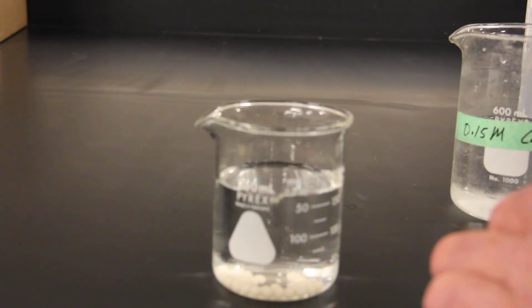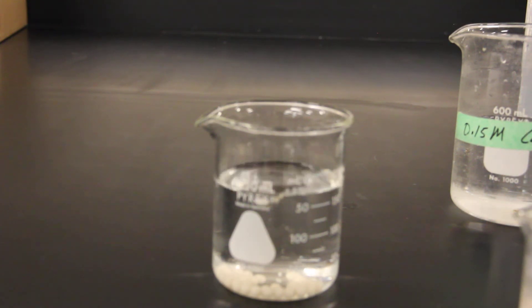So I'm going to continue to make a bunch of yeast spheres. This is only a hundred milliliters of solution, but I can make enough yeast spheres to do this trial many many times. I can probably make four or five hundred of these yeast spheres just with this amount of material I have here.